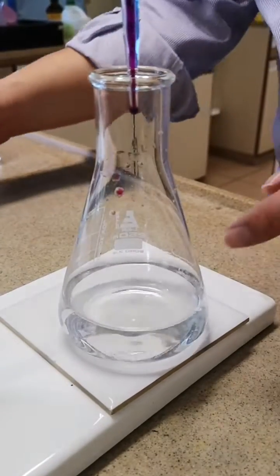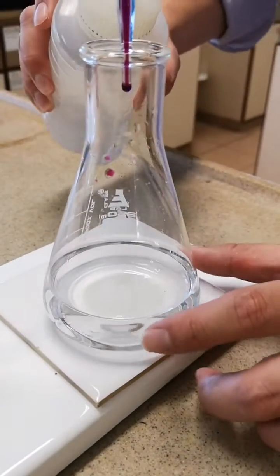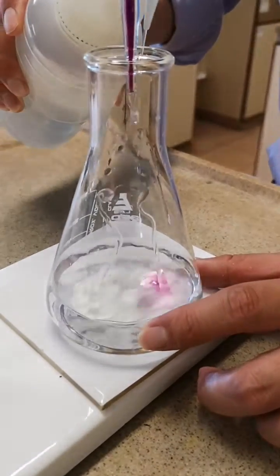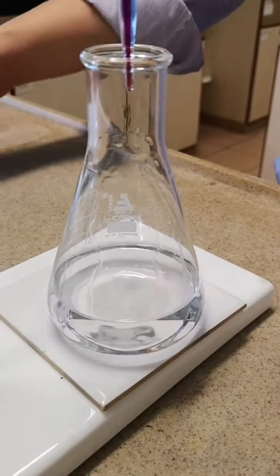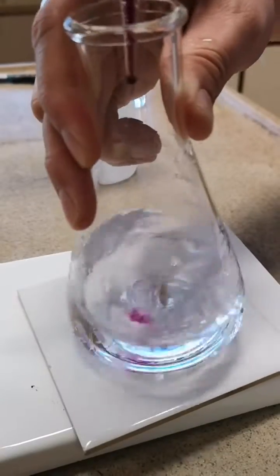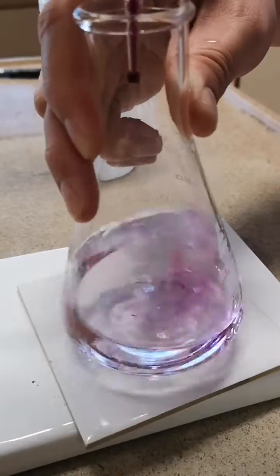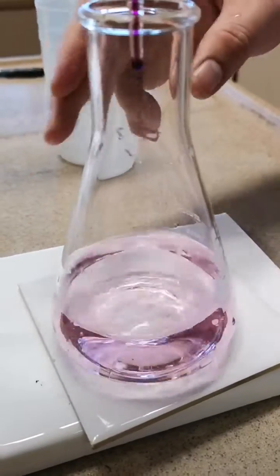As you can see, there is some KMnO4 spillage on the side of the conical flask. You may use a deionized water bottle to rinse the spilled KMnO4 into the solution in the conical flask. Now that's the end point of the titration.